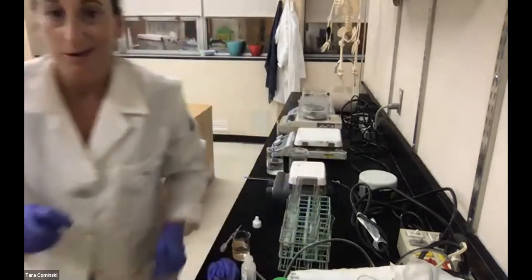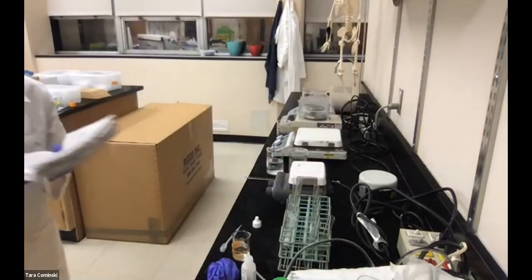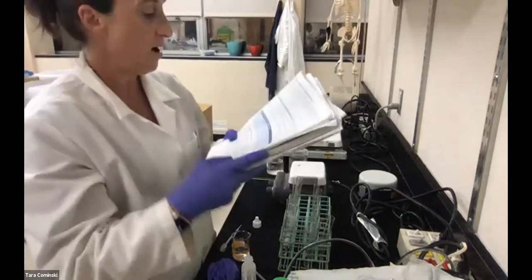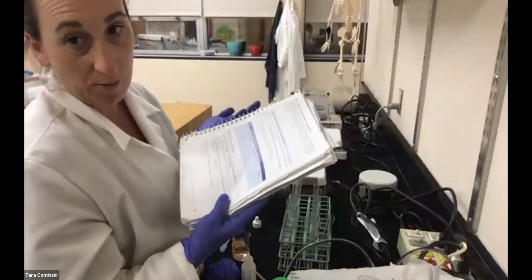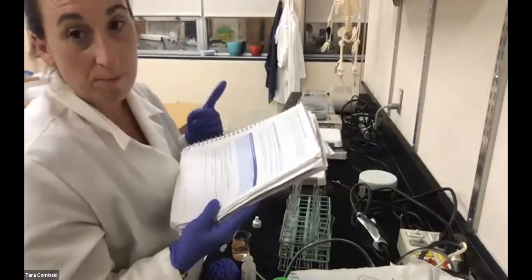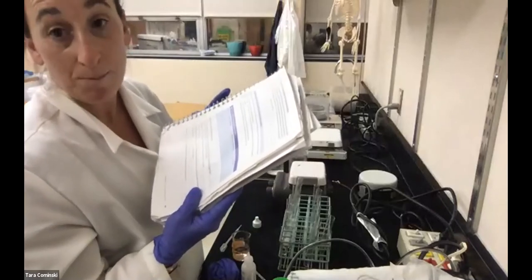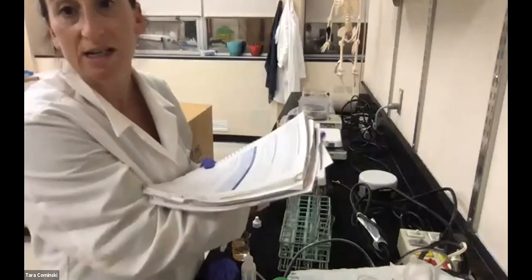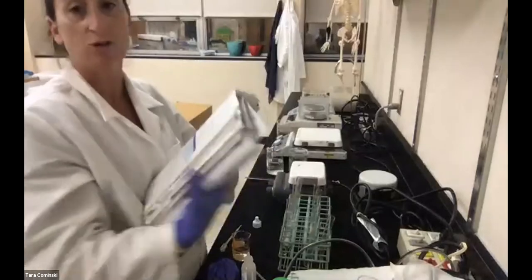Okay, so that concludes that experiment for the effect of concentration, meaning how much enzyme is there. Again, tube 1 had no enzyme, 0 millimeters. Tube 2 with 1 milliliter of enzyme was 100 millimeters, the bubble column height. And then tube 3 was 120 millimeters. There is no graph for this one. It's just completing the table and answering the questions.